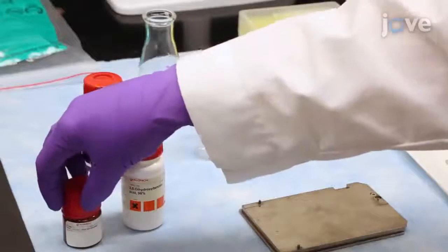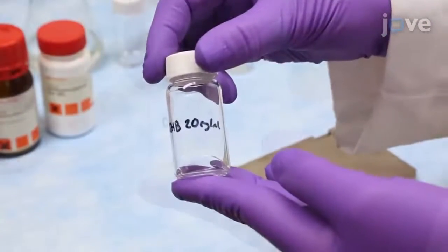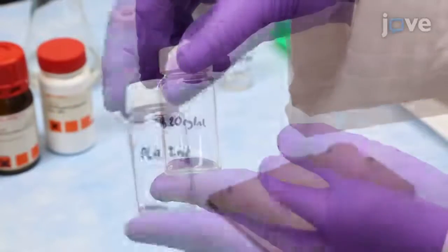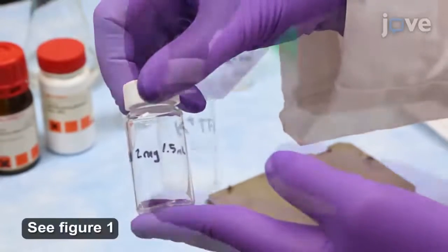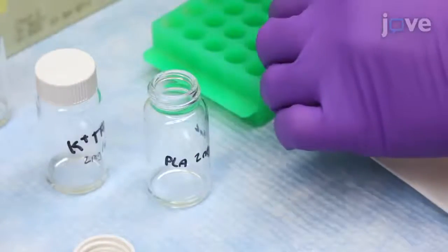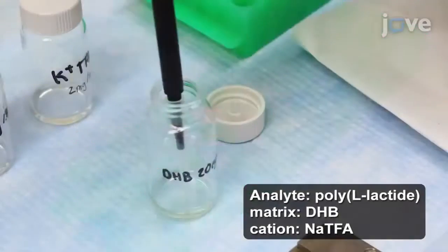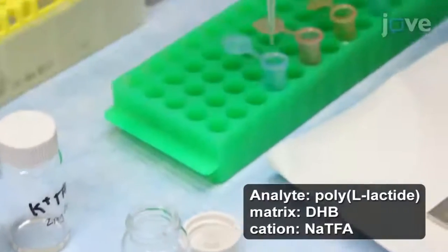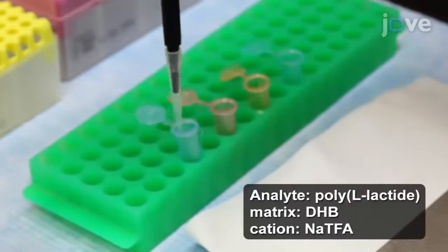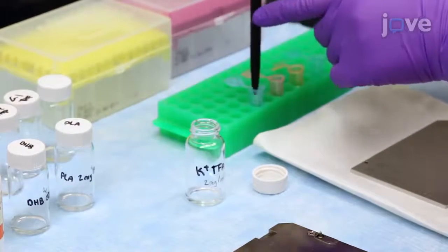First, prepare a series of solutions by mixing previously prepared matrix, analyte, and cation solutions while varying the relative proportions of the components such that 9 unique sample mixtures are made. For this experiment, combine 15 microliters of poly-L-lactide solution with 15 microliters of 2,5-dihydroxybenzoic acid solution and 1 microliter of sodium trifluoroacetate solution.